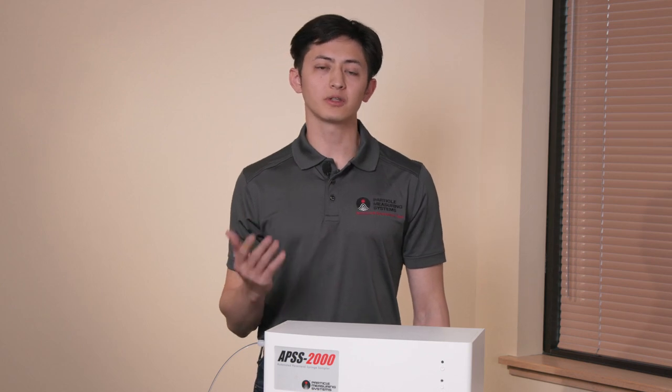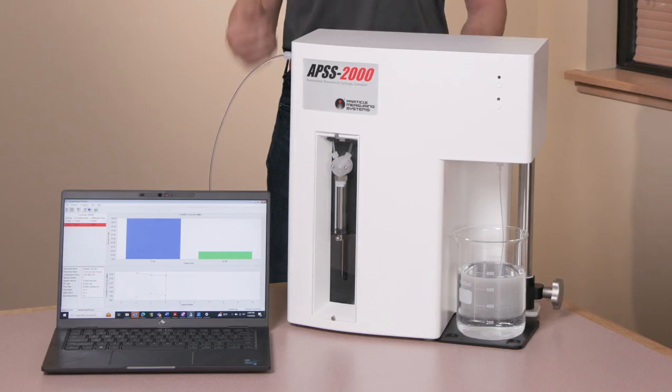This unit is a great option for those looking to sample for particle contamination in injectable pharmaceuticals, on medical devices, ophthalmic solutions, as well as an array of other applications.